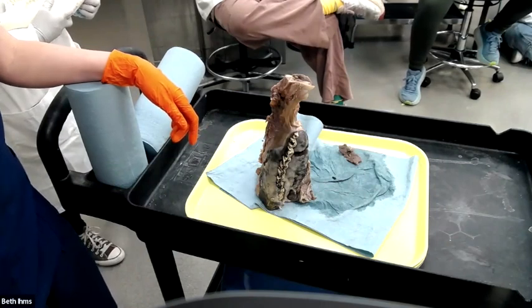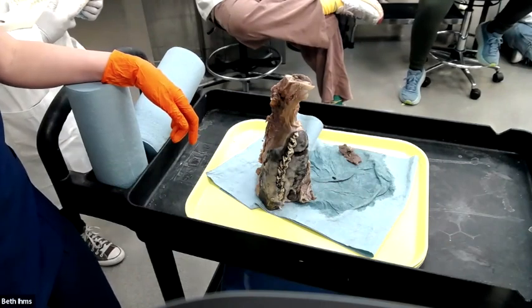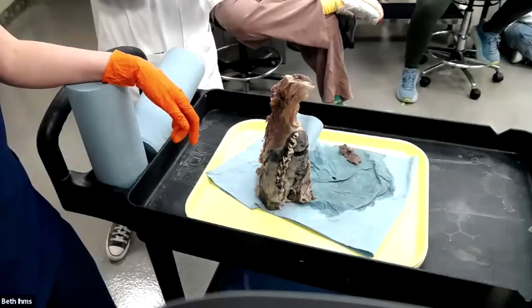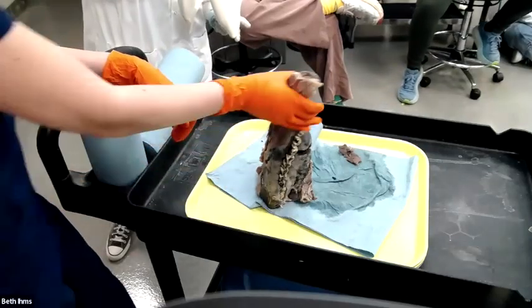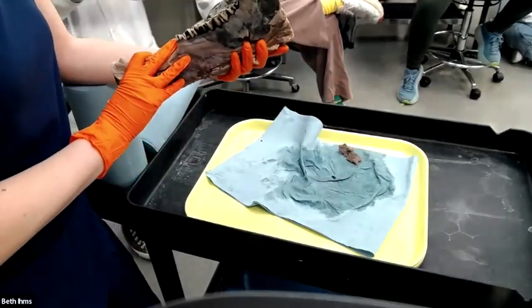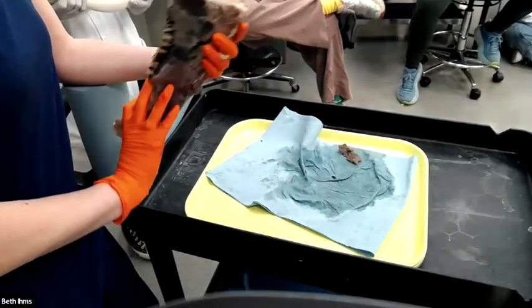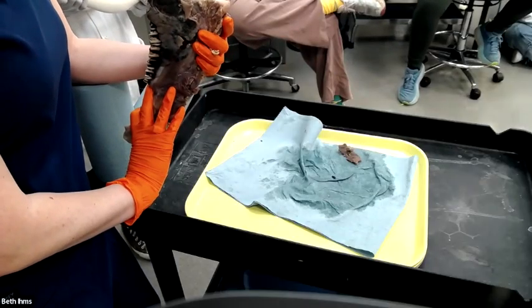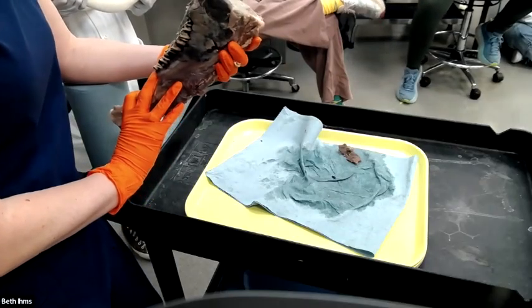Yeah. It was beautiful. It's a beautiful lesion. No, this is actually a lytic lesion. We are destroying bone. We're replacing bone with granulomatous inflammation and fibrosis.